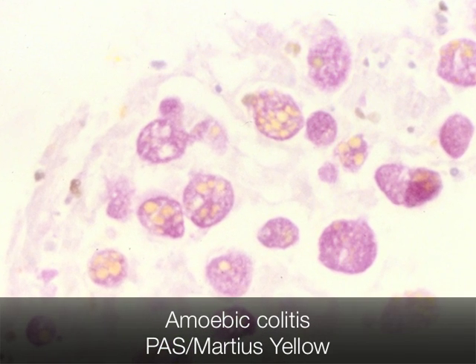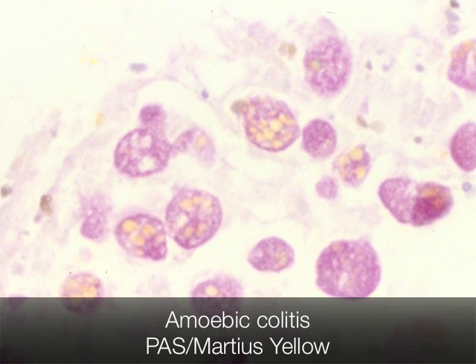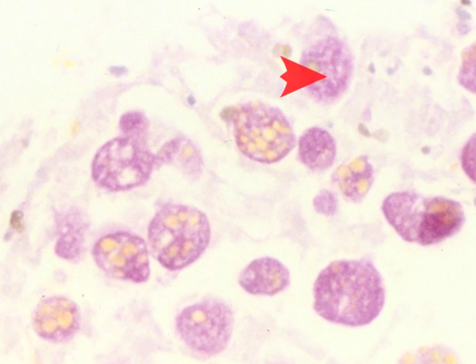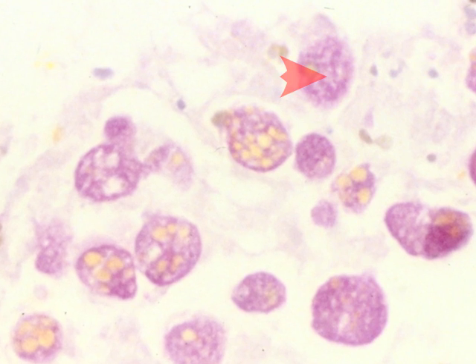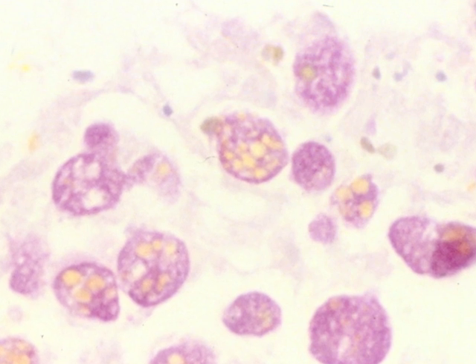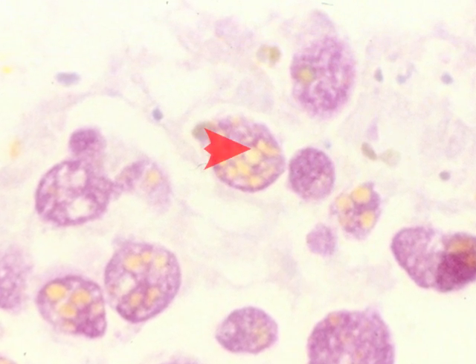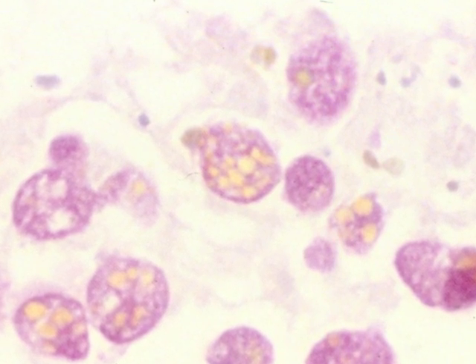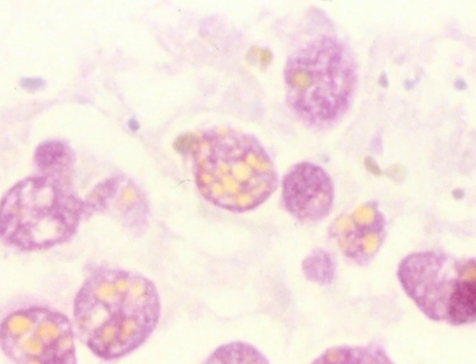The stain used to demonstrate the amoebae here is the PAS stain, which stains the amoebae magenta. Martius yellow has been added, which stains the red blood cells that the amoebae have ingested yellow. The PAS combined with Martius yellow is therefore quite a useful stain for diagnosing amoebic colitis.